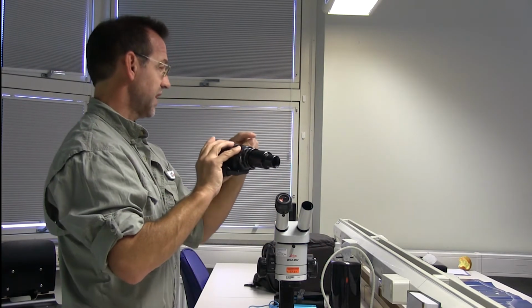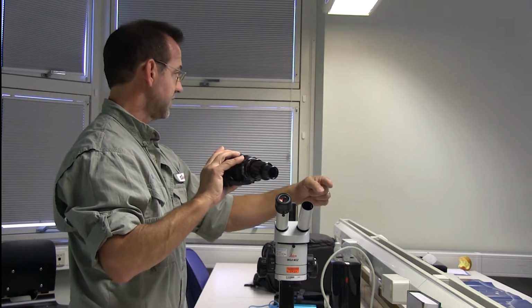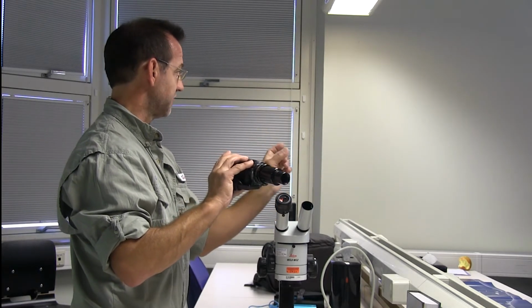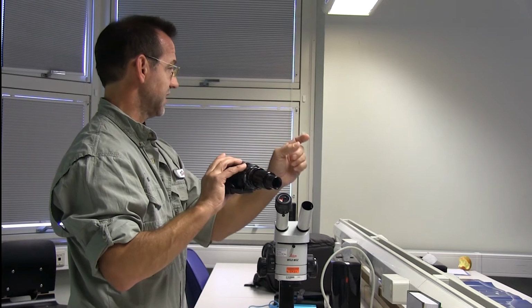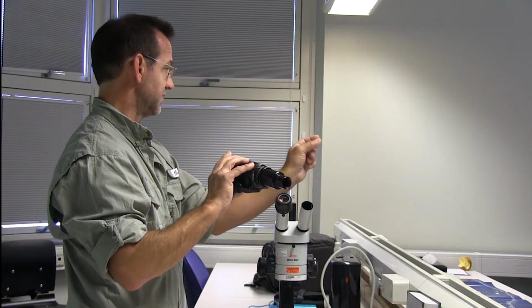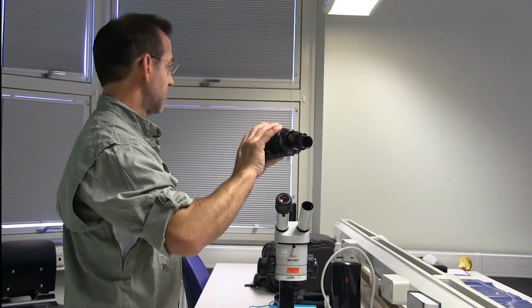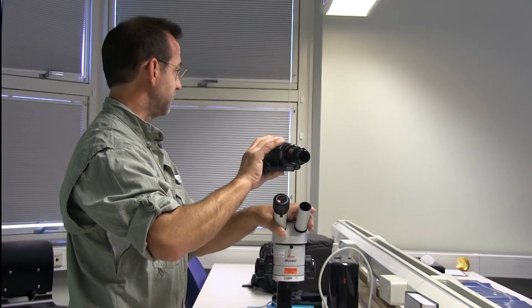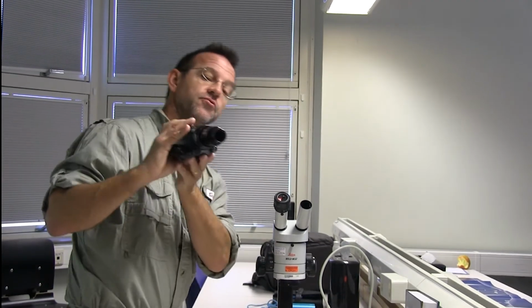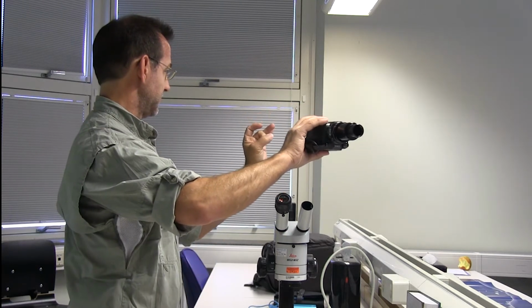So you're kind of using more than the magnification of the microscope. So it's hard to get an exact estimate of what the size of the organism is unless you measure everything ahead of time and you have a standard. So when you zoom in, you know how big the organism is, because you're zooming in farther than what the microscope is doing at low power, let's say. So if you zoom back out, that's not the picture that you want. You don't want that little circle there. You just want to fill the screen.